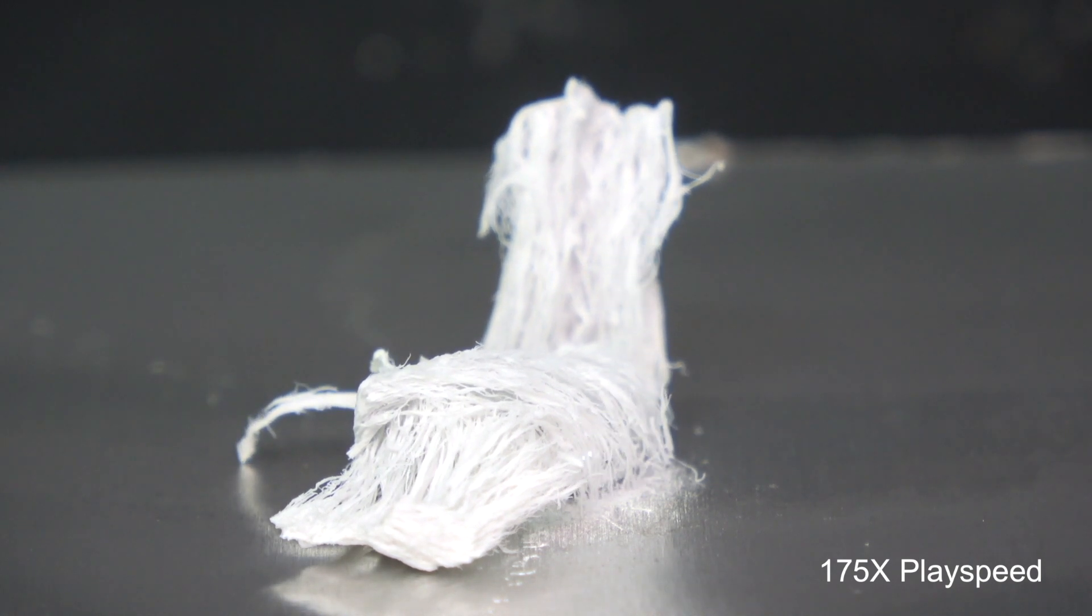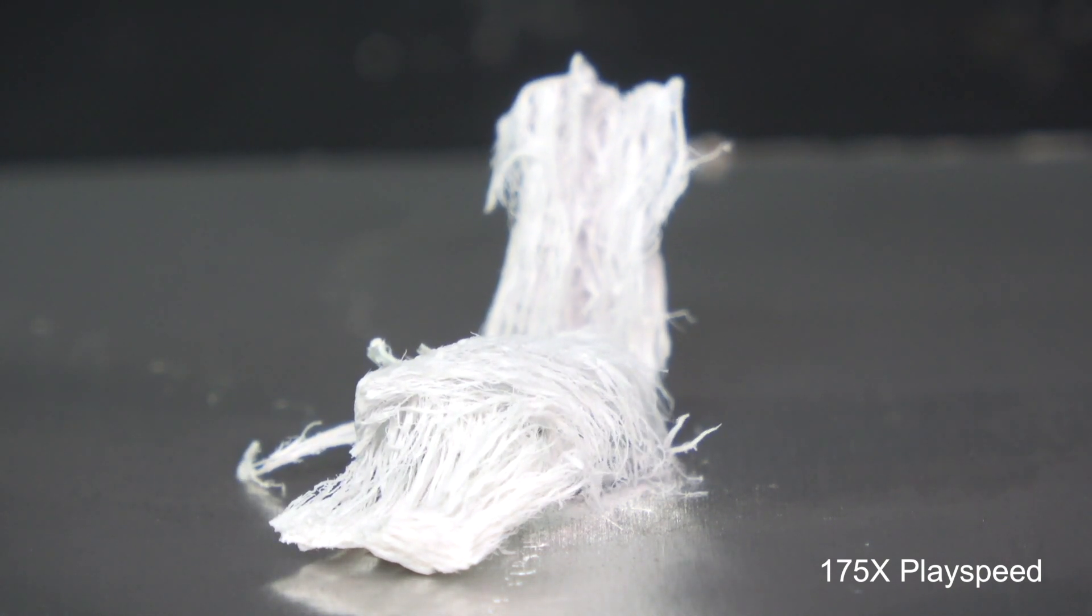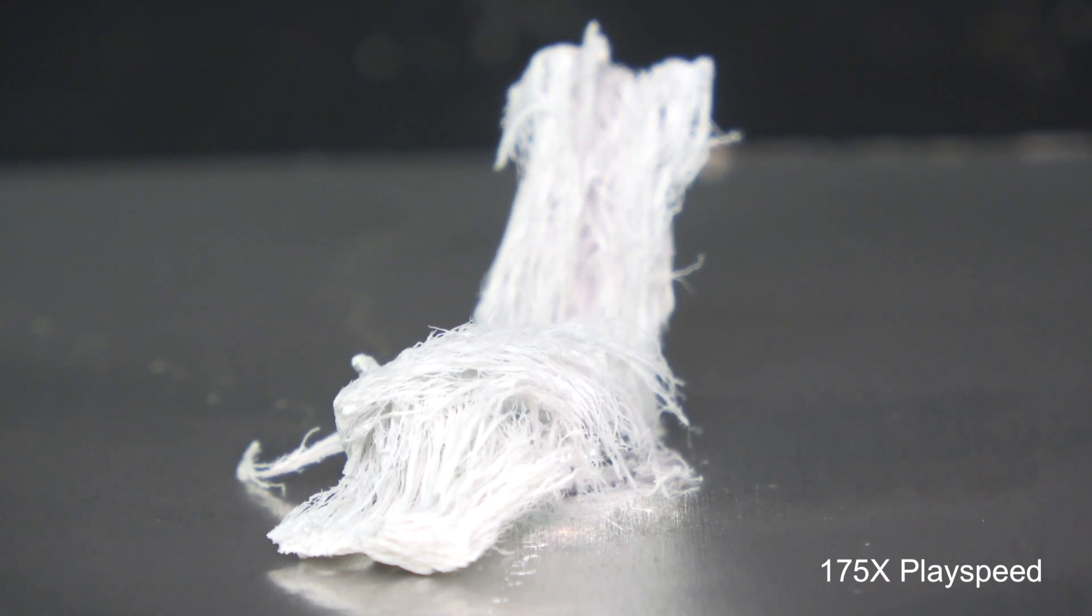This is also a very slow process. What you see here is a time lapse of a few hours worth of footage.